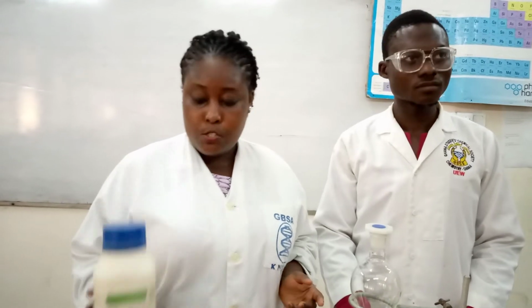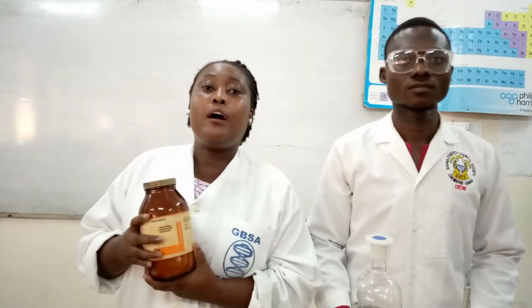So I'll quickly hand over to Lau, but before Lau comes in, let me tell you the acidic compound and the neutral compound. The benzoic acid is our acidic compound, and this is our neutral compound, naphthalene.